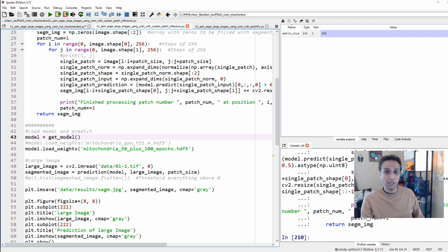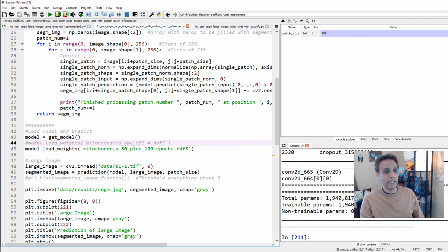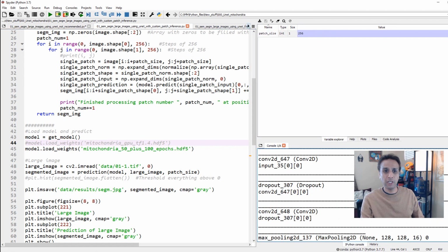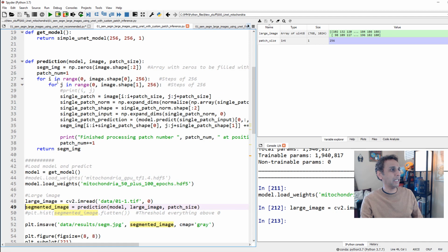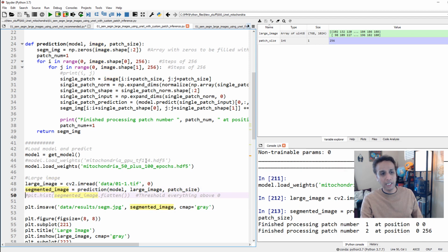Now let's go down and get the model, right? We did exactly the same thing before. Let's go ahead and get the model. This model should be pretty much the same as what we have done before, 256 by 256 by 1, and so on all the way. So pretty much the same model, and we are importing the same weights. It should be fine. And the next thing is read the large image, right? We read the large image, and my segmented image is basically run this prediction function using my model. That's my input image and patch size. Okay, so let's go ahead and run this, and there you go.